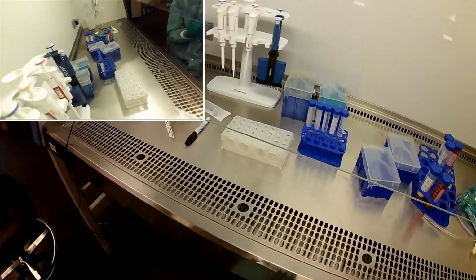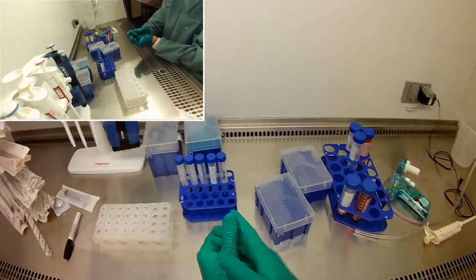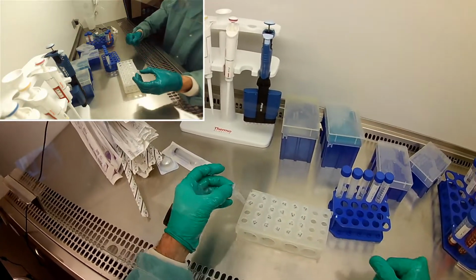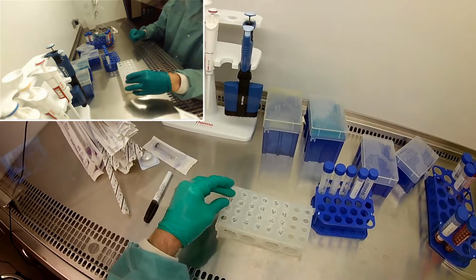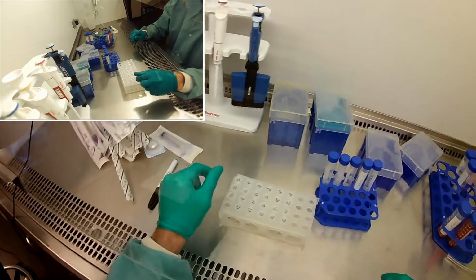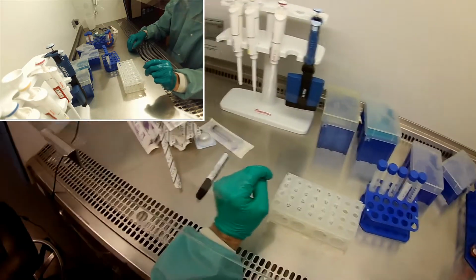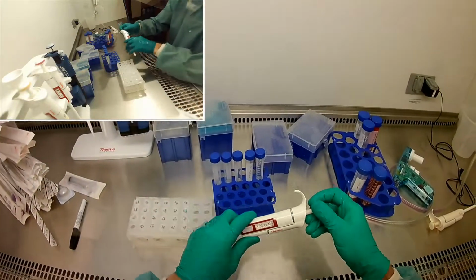Okay, so I'm going to go ahead, while we're waiting for that sugar to dissolve, let's do these. These are pretty easy to do. So really, I'm just going to start with I measured out some 100% ethanol, 100% bleach, and 100% antibiotics. So I have those to use. And so in order to make 8% ethanol from 100%, we're going to make 2 mils of it. You guys should be able to do the math on that.